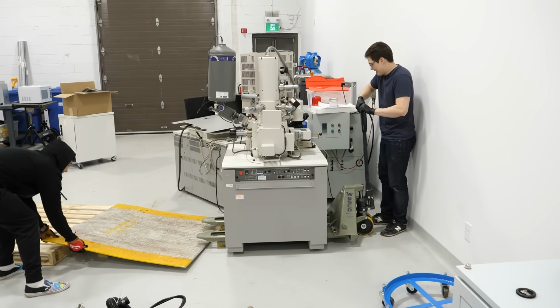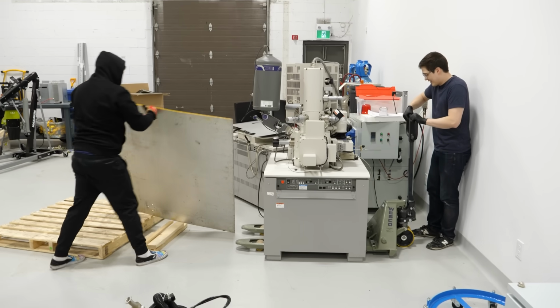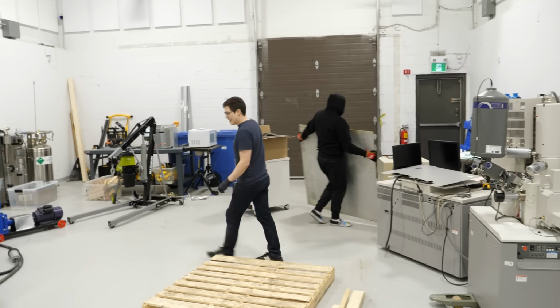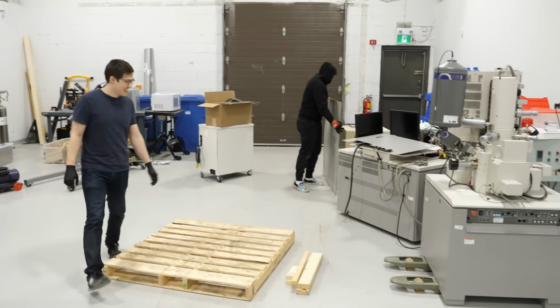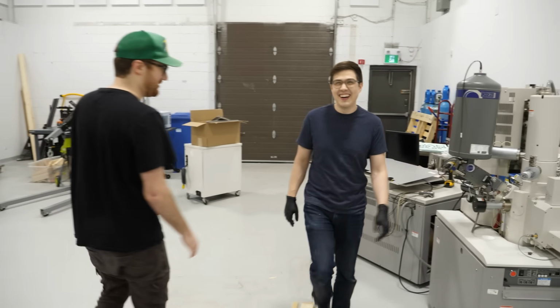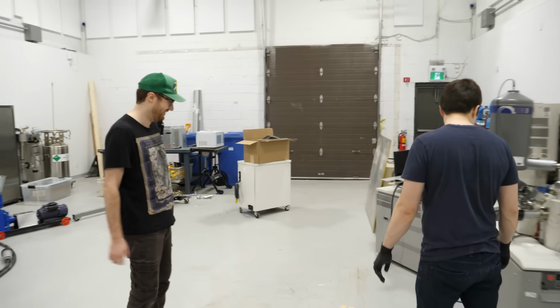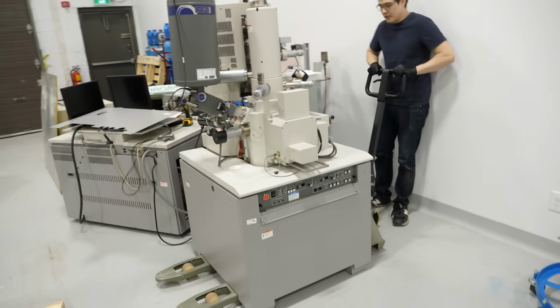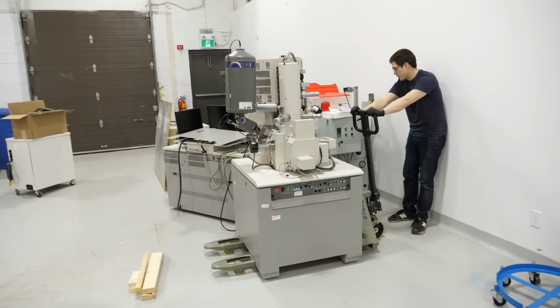Oh my god. It worked. Dude. That was easy. Dude, epic. I dreamt about this plan. I'm so happy it worked. Zach. Oh, that's sick. Now that it's like this, moving it is trivial. Like, look, I'll show you.